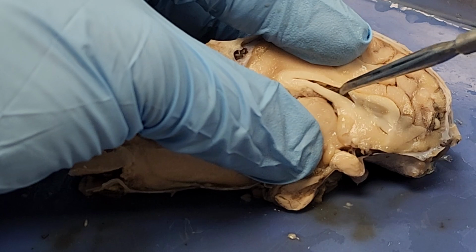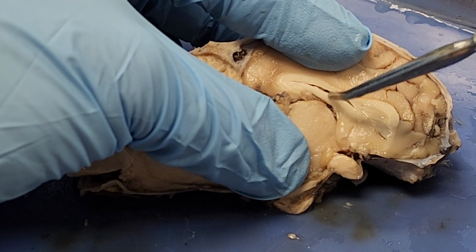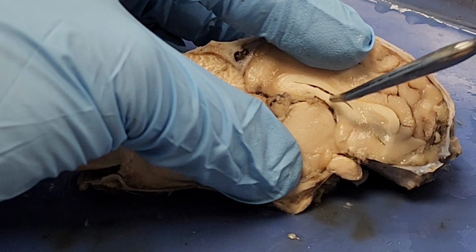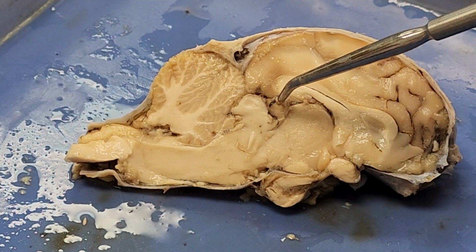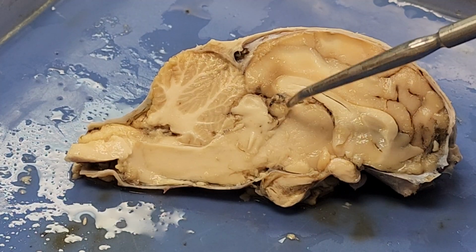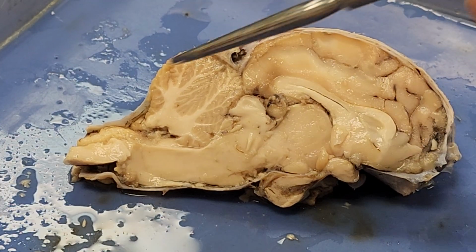This is one of my lateral ventricles, where cerebrospinal fluid flows through. And this little edge, the little lip to it, is my corpus callosum, which connects the two sides of my cerebrum so that they can communicate with each other. Now, this little ball right here is my pineal gland. That's the one that secretes the melatonin that regulates your day-night cycles.